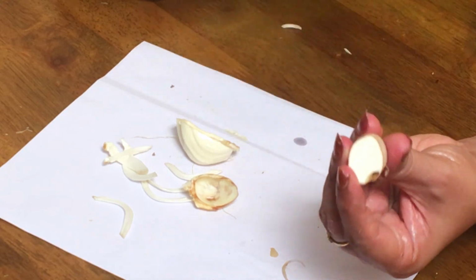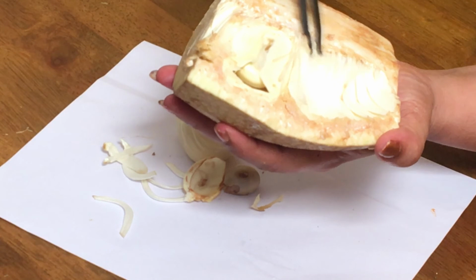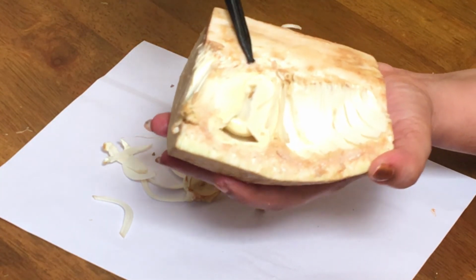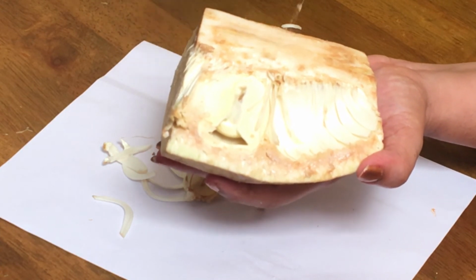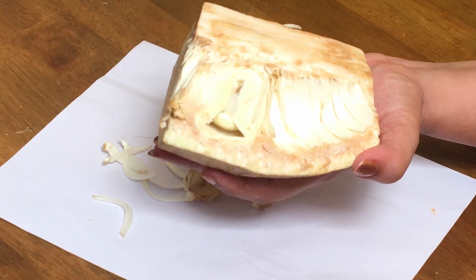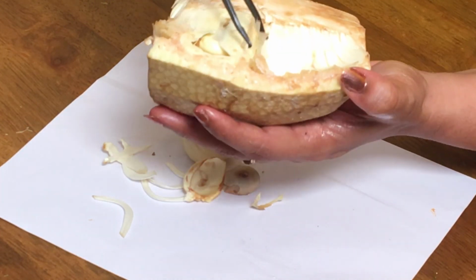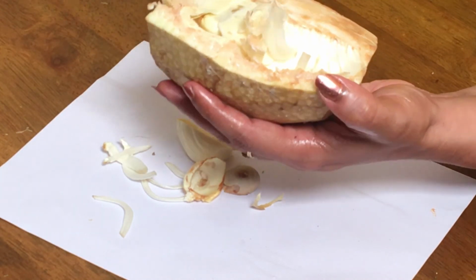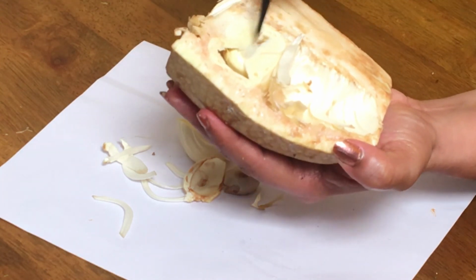This is the endosperm of it. Jackfruit is also a multiple fruit which is called sorosis, and you can see here it secretes a sticky, gummy latex. See, you can see this is latex, and these are all the bracts of the flowers. So many flowers were there here, and these are all the bracts of the flowers, which are generally not edible. Only the perianth becomes edible, and even the seed is edible.